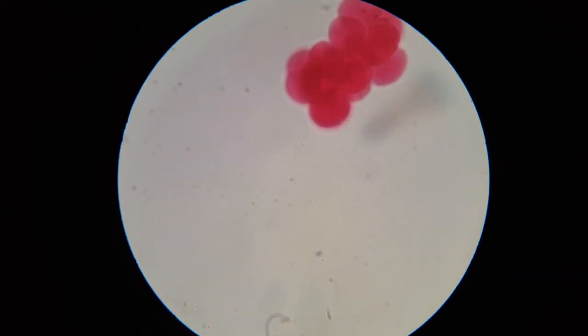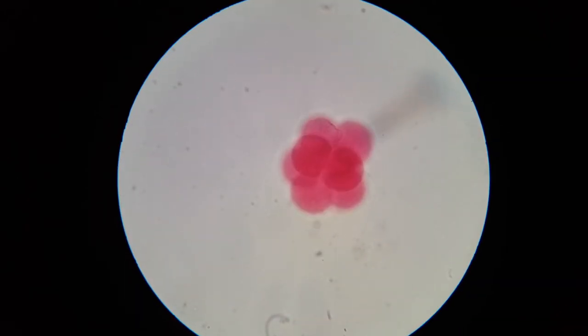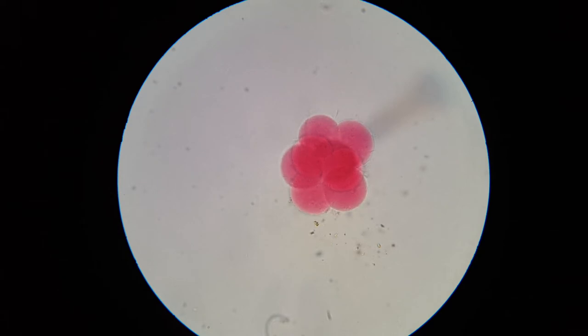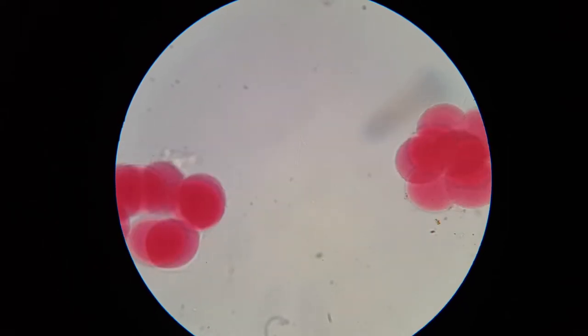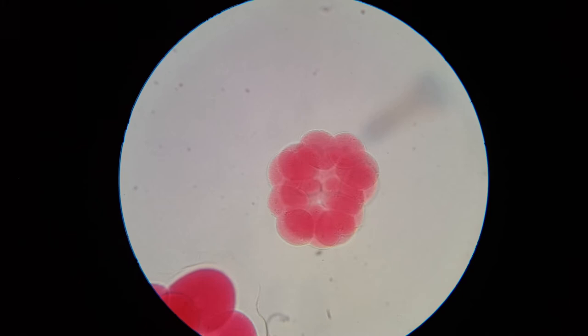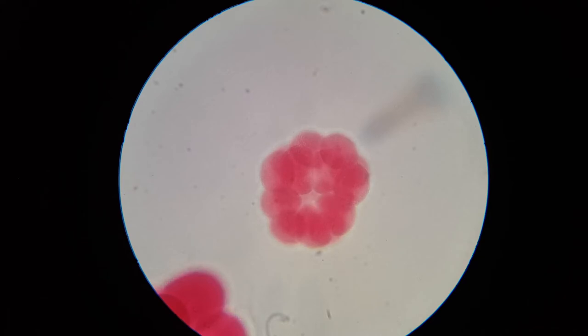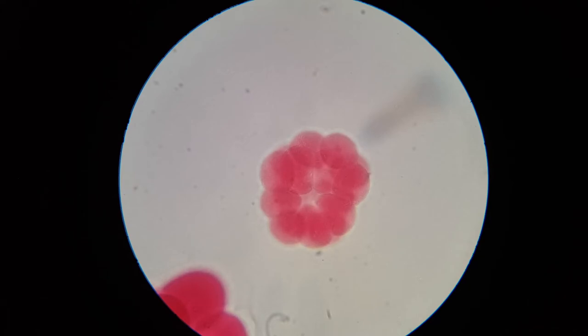We're removing that and switching into place the 16-cell stage. Not changing the focus at all — we're getting lucky again, well, not perfectly lucky. This slide is Starfish 16 Cells. I have a little difficulty with this slide because I don't think everything is in the same stage. That's pretty much 16 cells — you can kind of see maybe six or eight on top and maybe eight underneath.